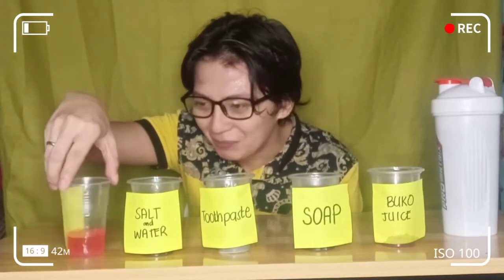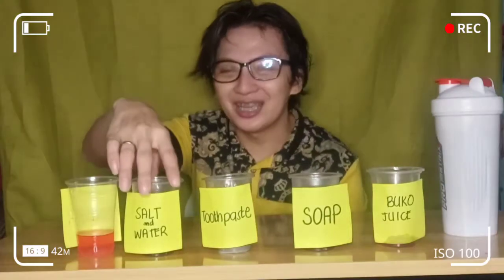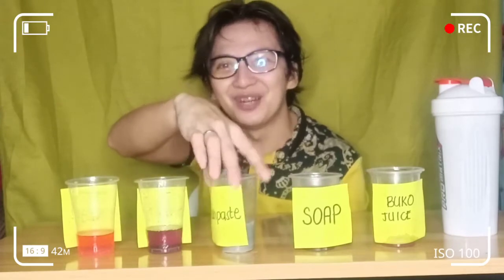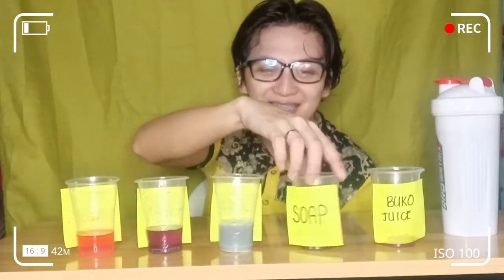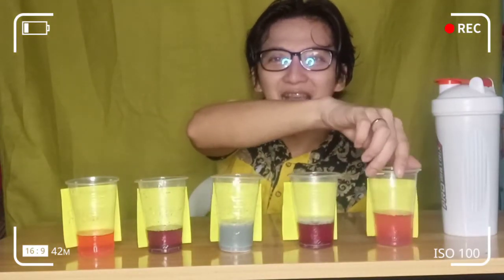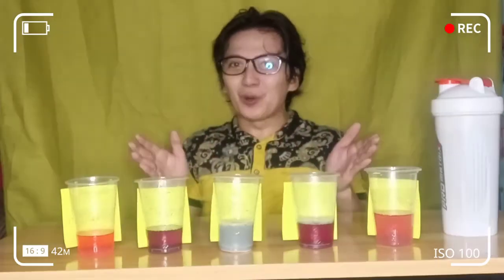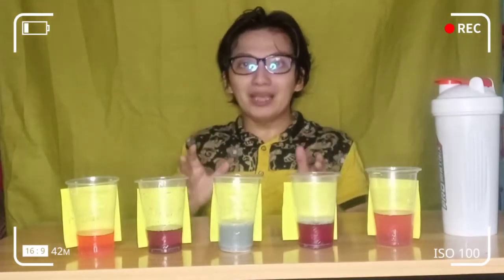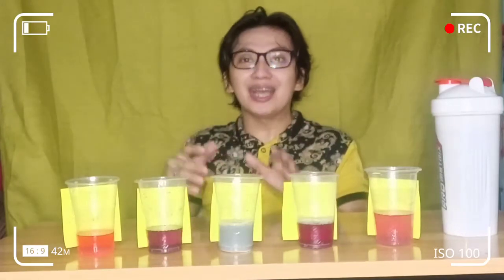So it's the vinegar. Can you see the color now? How about the next one? And we have the next one. And how about this one? And we have the last one. You can see that the colors vary — a while ago some of them were white, some of them were colorless. But based on the color, we will identify which is a base and which is an acid.